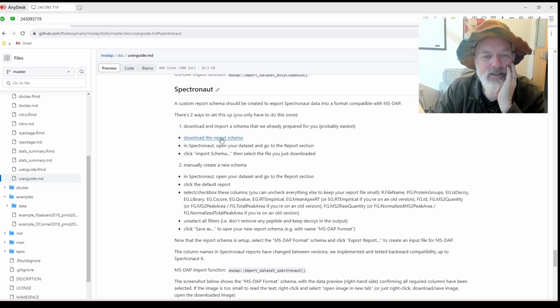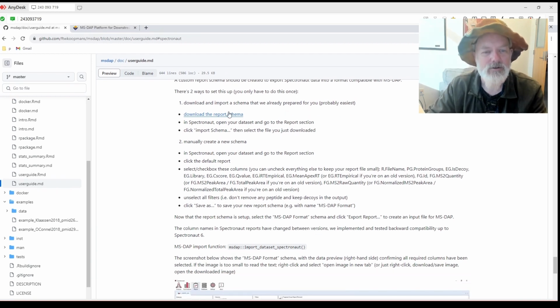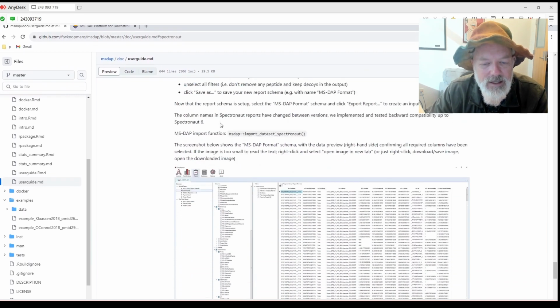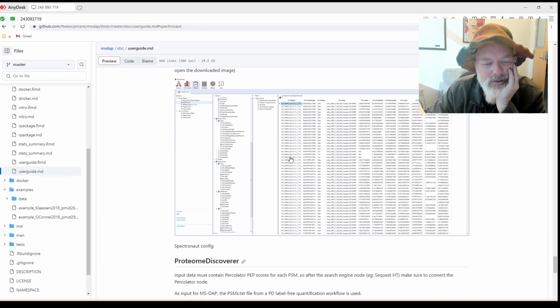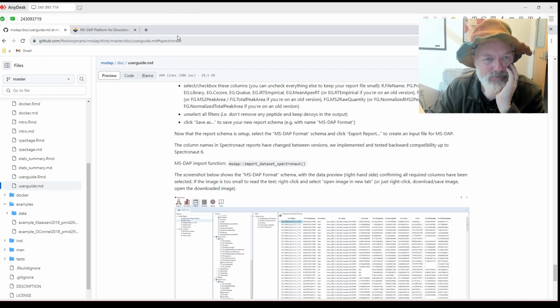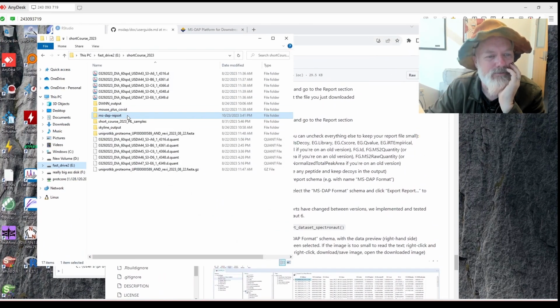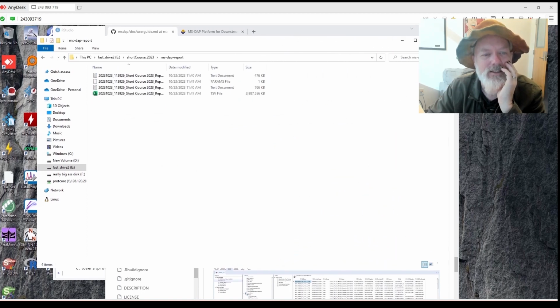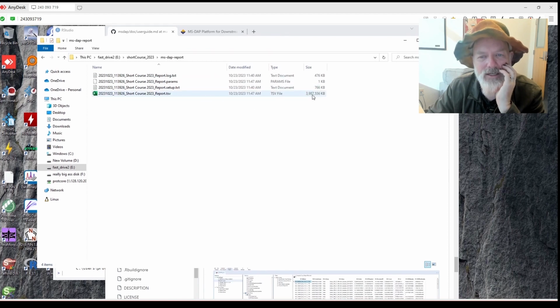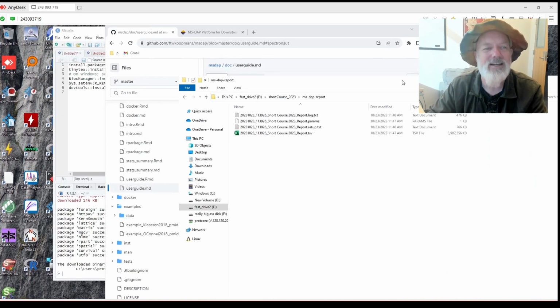And it's going to give you the schema you could download. So when you export a report from Spectronaut, you can have these really cool schemas that tell you what columns to have. So we're going to download this report schema, which I believe I already did. And then this kind of just tells you what the report schema looks like. These are the columns that it selected. And basically we did that. We put it all in the Spectronaut and exported a report. And it's a rather big report because it's like 117 different files, about 4 gigabytes of a TSV file, or a tab separated values file, about 4 gigs. That's big. So we'll see if this works.